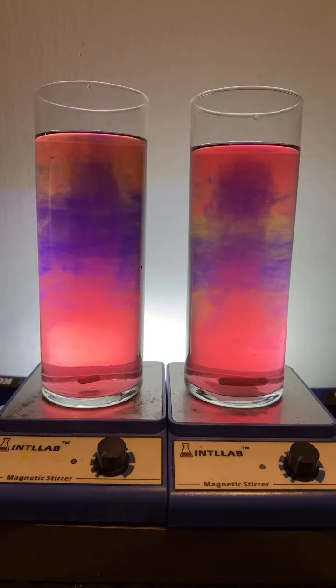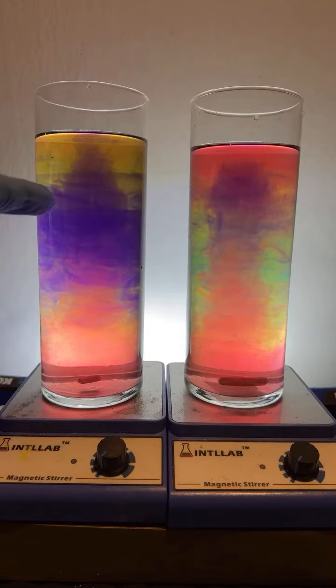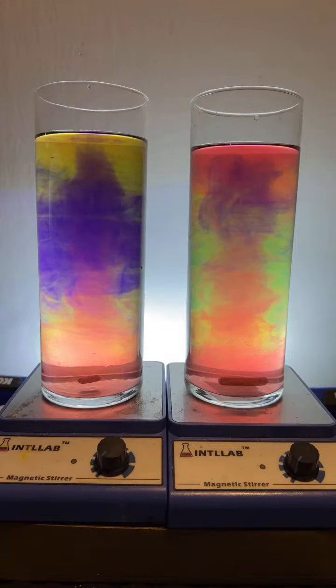Pollock, yeah, I do some different experiments live. This is the one I mostly do. Make red and green for Christmas. We could try that for those that celebrate. I recognize all the ones. I hope you get there. Josie, I think violet's my favorite color. I got some violet going on. I see. Late night, I don't have any of those solutions made up.